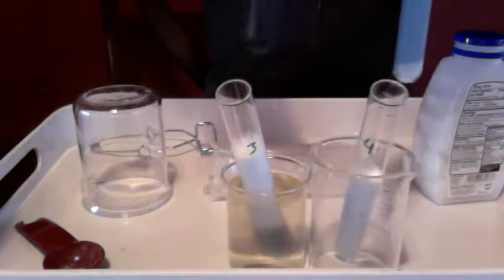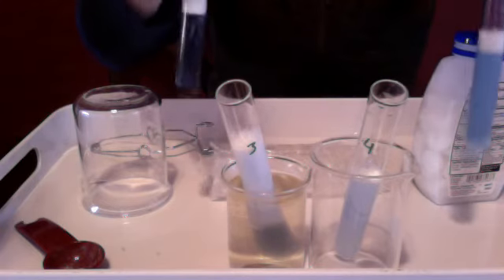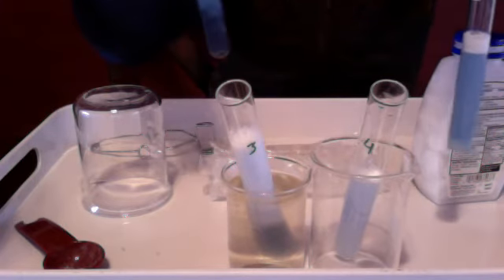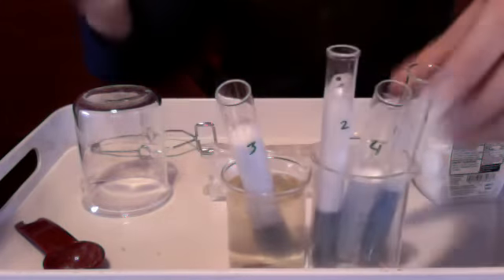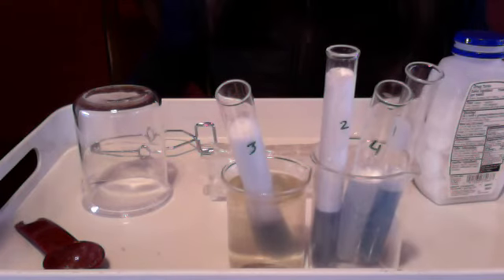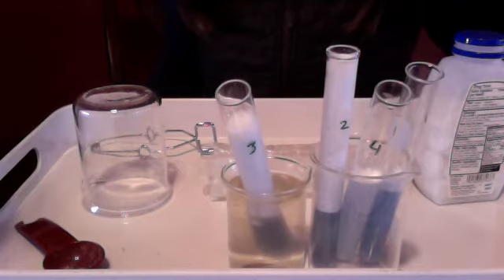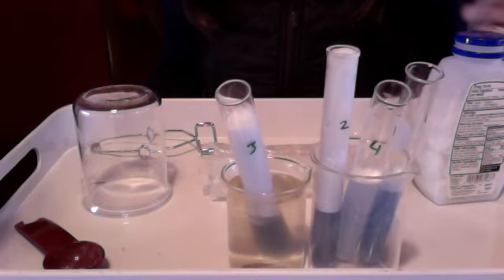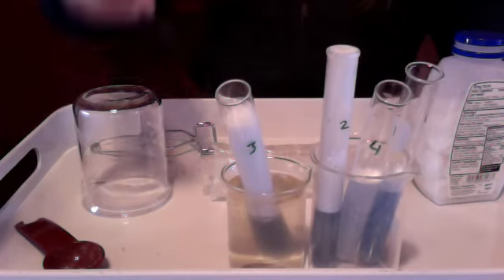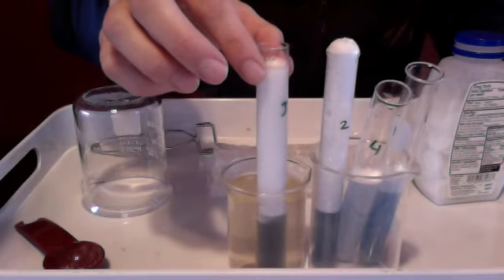Number 2 looked like it did a big reaction, but I think some got stuck. I might have to help that along. Ugh, wish I was wearing gloves. Okay, now it's making a mess. All right, there's 2, way up there. It looks like we just had a little problem. It started reacting and then it got stuck on its own foam because it was such a small particulate. So it has now far exceeded 3, so everyone knows.